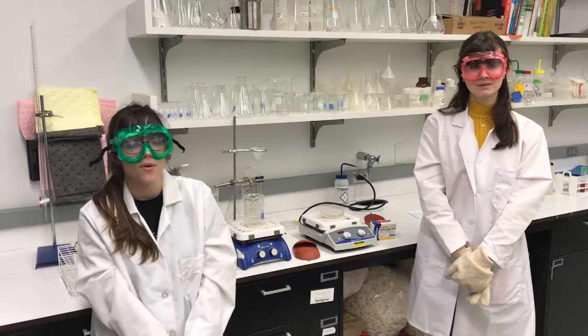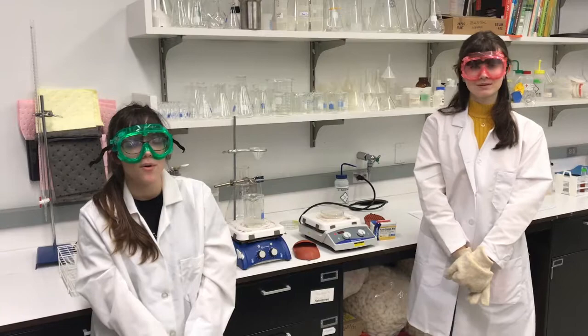This lab teaches the sublimation of caffeine, which you can use to teach the phase change unit or separation of mixtures.